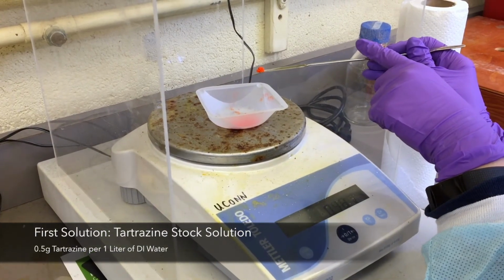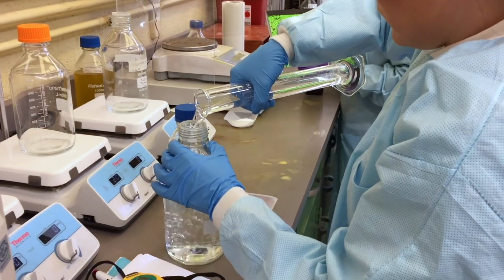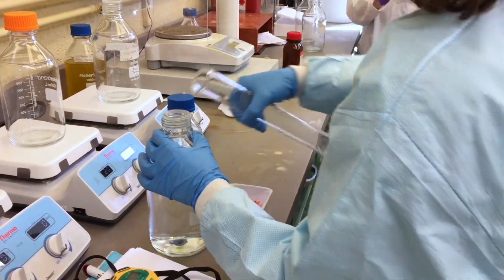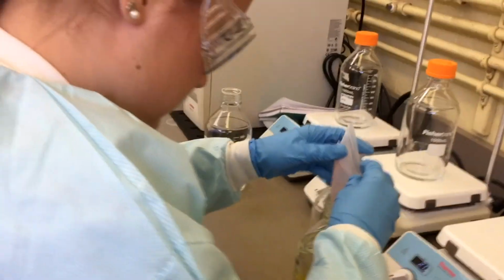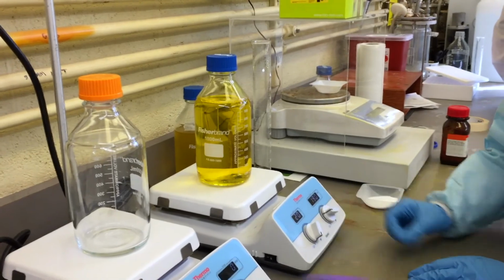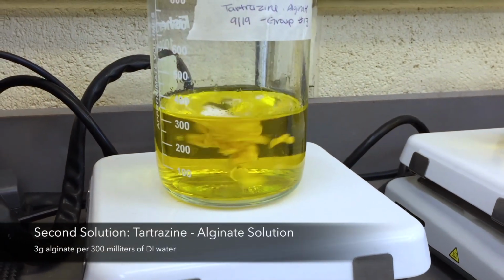The first solution that needs to be made is a stock solution of tartrazine, which is done by measuring 0.5 grams of tartrazine for every 1 liter of DI water. The DI water was measured using a graduated cylinder and poured into a 1 liter container with a stir bar. The tartrazine was added to the water and stirred until all clumps of the dye dissolved. It is important to make sure to cap the container to ensure that the DI water does not evaporate while the solution mixes.